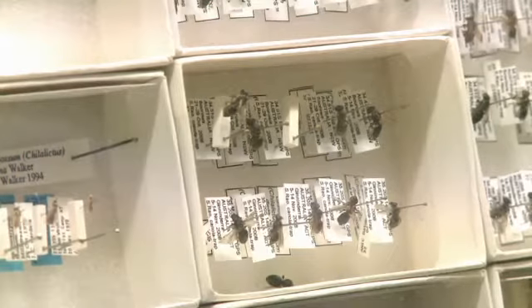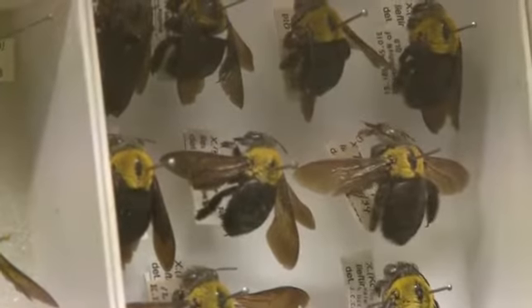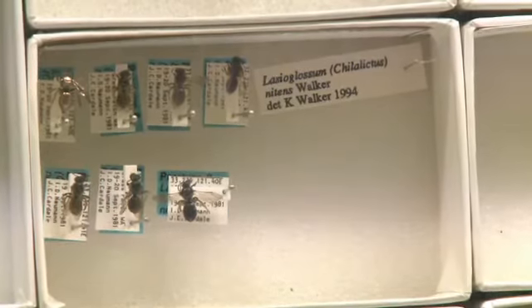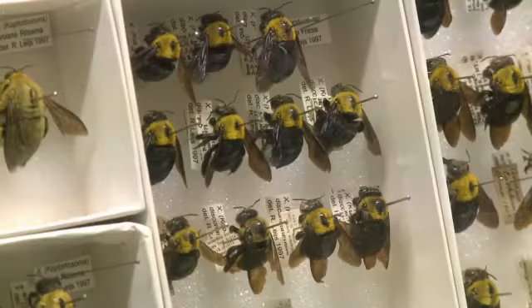Here we have a variety of bees in the collection. They're data-based. We know exactly where they came from, exactly when they were collected, and they all have pollen on them. If we can come in, automate the process of figuring out all those pollination associations on all these bees, we can build a pretty good library very quickly of pollination biology that's going to help us understand the ecosystem services that are supplied by pollinators, and help us get the right pieces when we try and put the puzzle back together of restoring ecosystems.